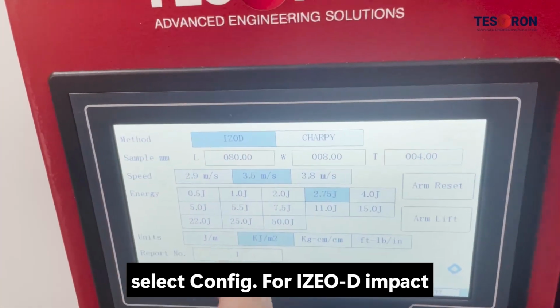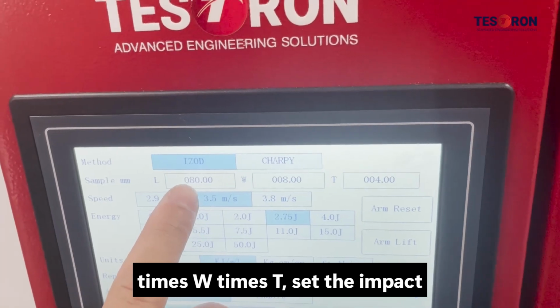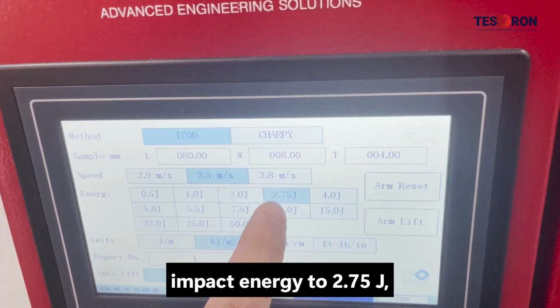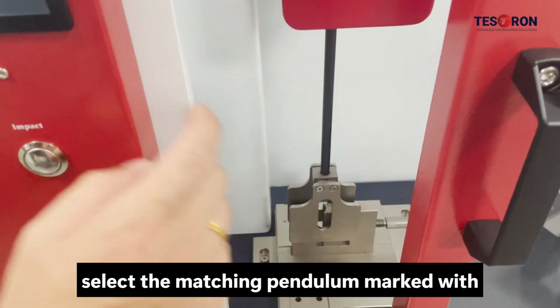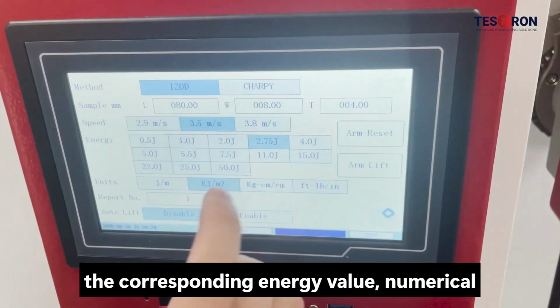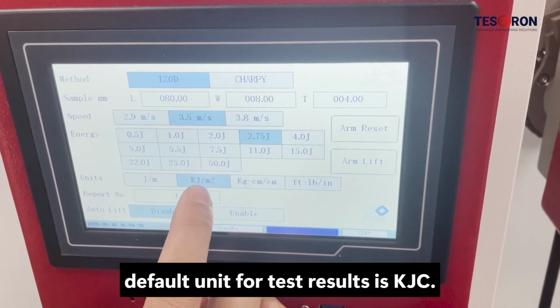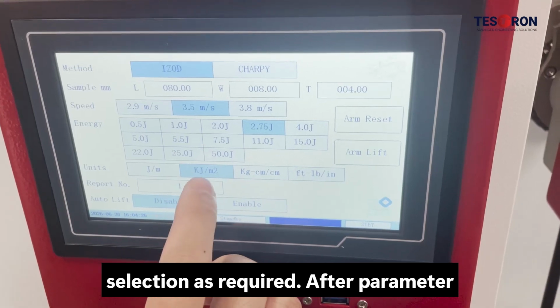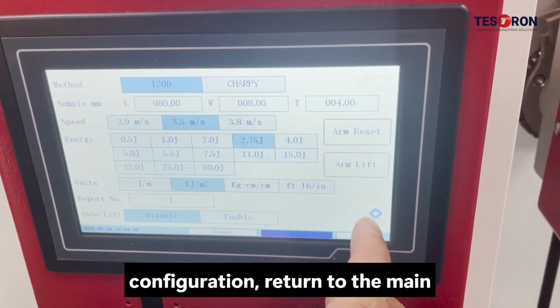For Izod impact testing, input specimen dimensions as L times W times T, set the impact velocity to 3.5 meters per second and the impact energy to 2.75 J. Select the matching pendulum marked with the corresponding energy value, numerical label engraved on the pendulum. The default unit for test results is kJ/m², alternative units are available for selection as required. After parameter configuration, return to the main interface.